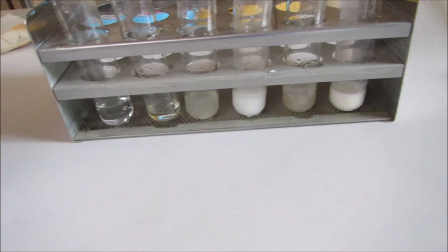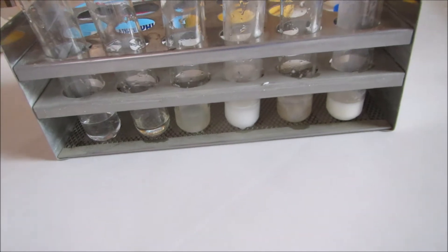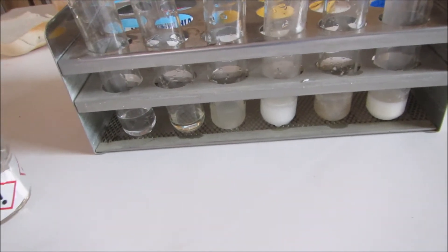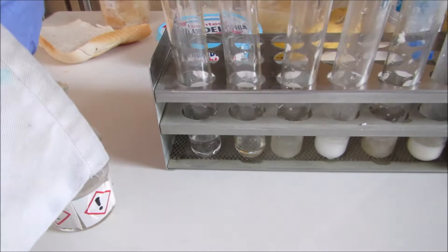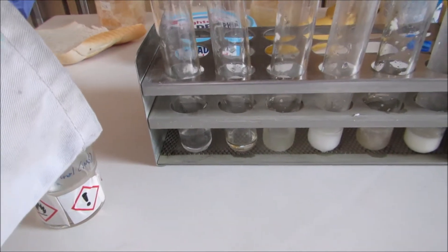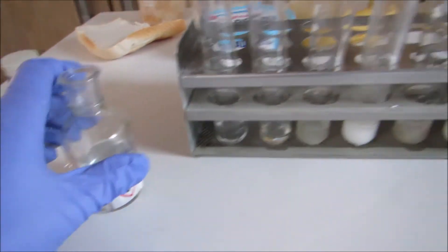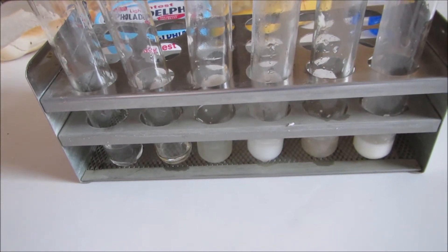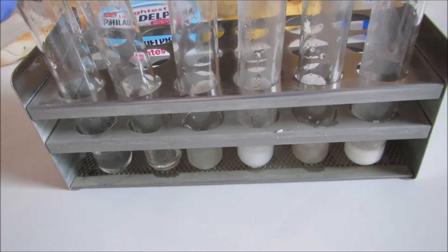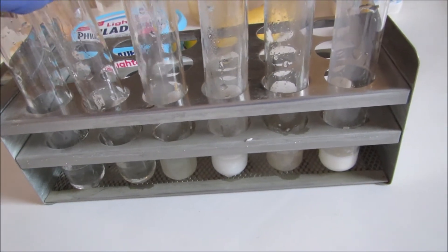To test for fats there are two different ways of doing this. One, you can put some of the solution onto a bit of brown paper and see if it leaves grease. Another is to add some ethanol to the solution, so I'm going to add some ethanol to each of them. I'll just quickly add to the whole lot and then talk through the reaction.